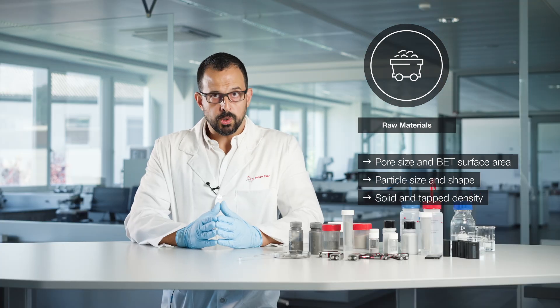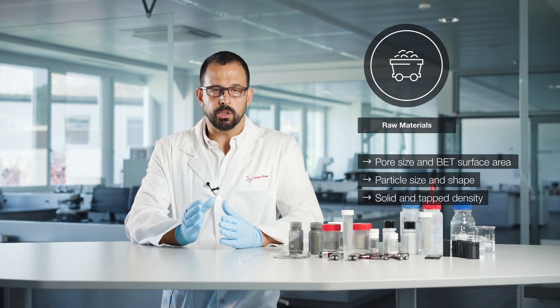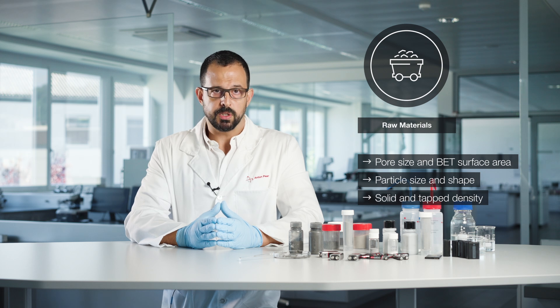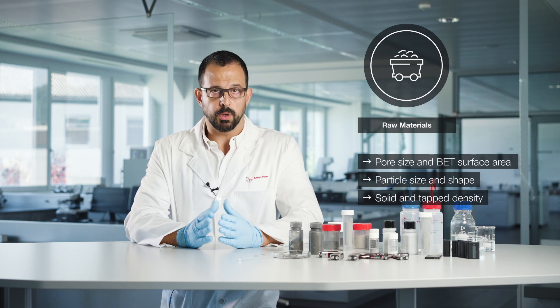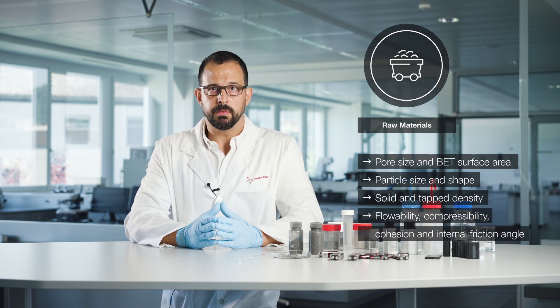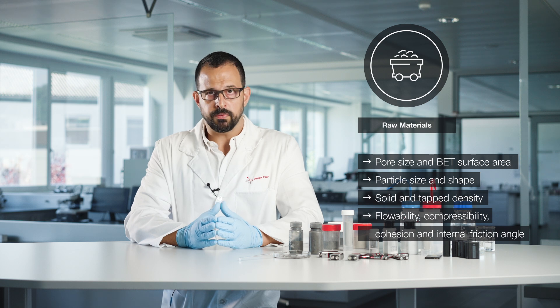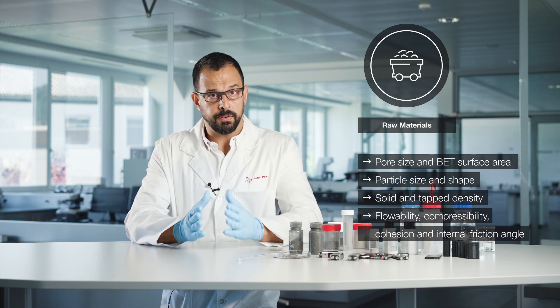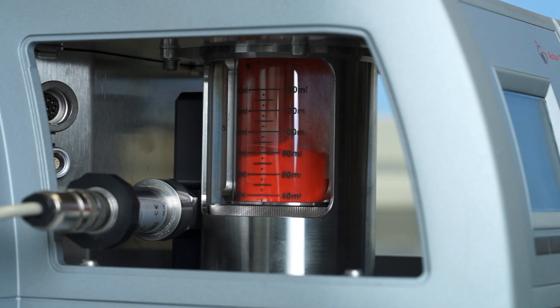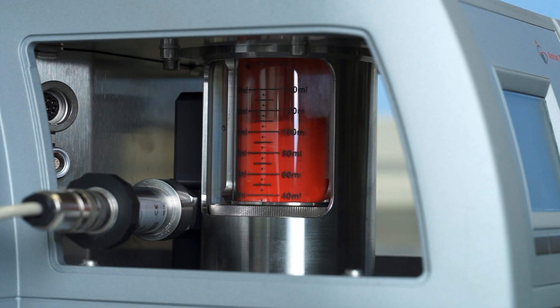It is also necessary to properly measure certain rheological properties of powders, such as flowability, compressibility, cohesion, and internal friction angle at different humidity levels. Here, a powder rheometer is the tool of choice.